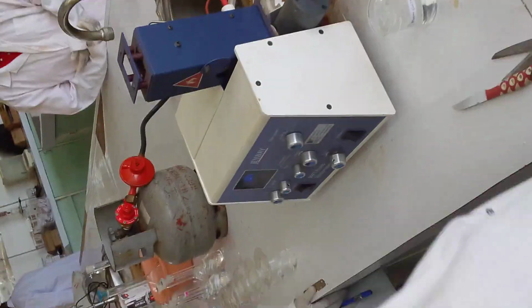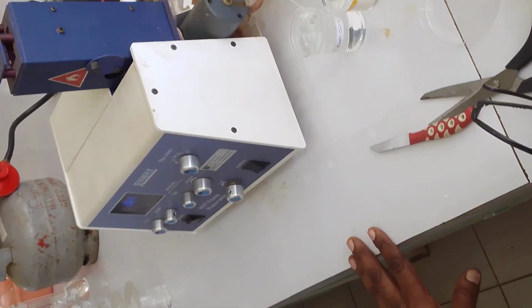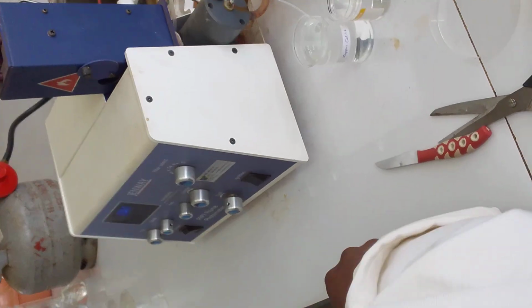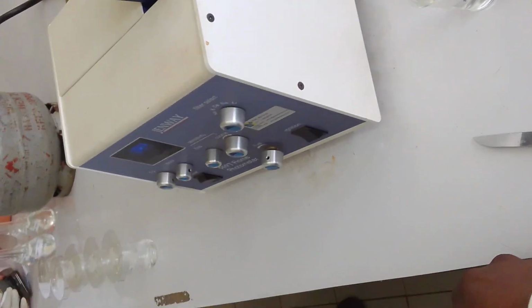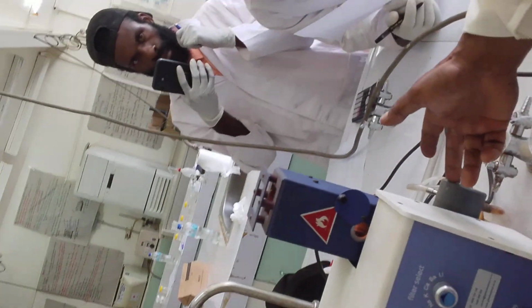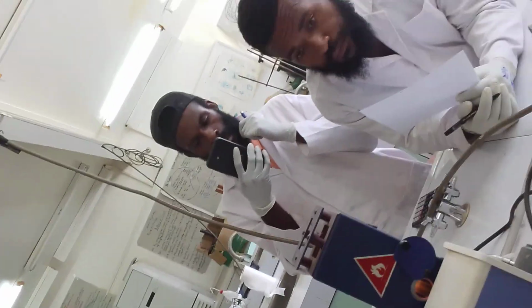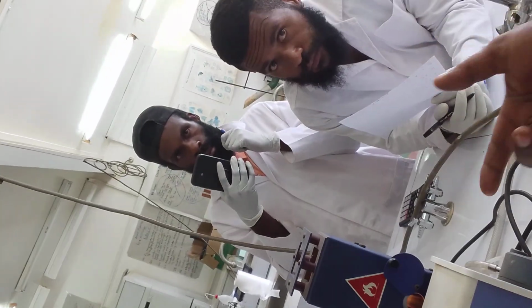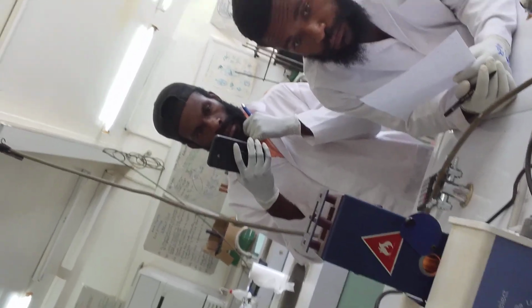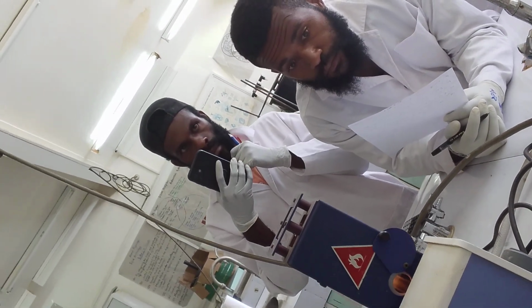For calibration, like when the people were trying, what I did, I had to hook up the connector just here, then I switched on the pump just to help the nebulizer suck in the samples. It goes in and sprays. Okay, for calibration, you will have to use distilled water, any blank.